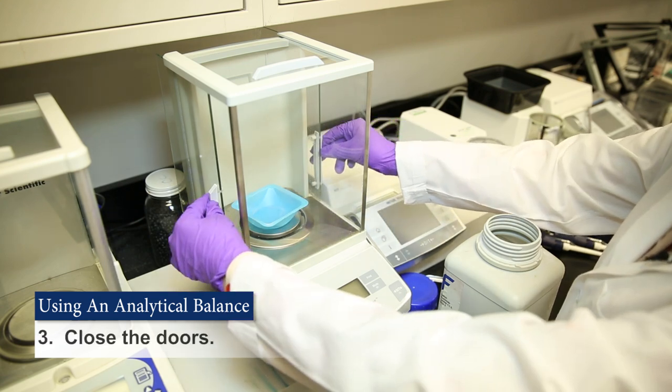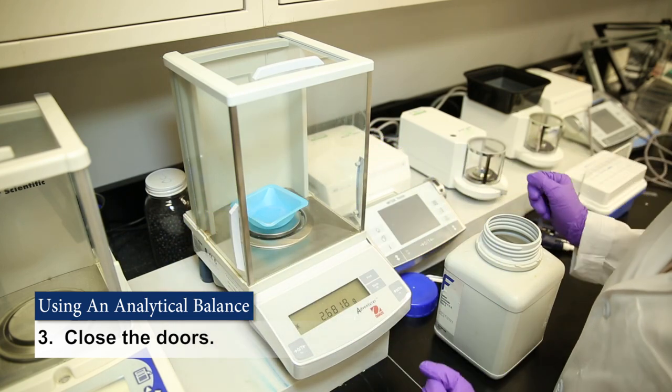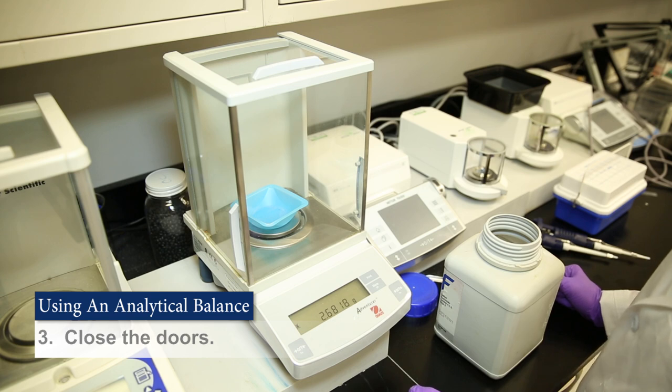You'll then want to close the glass doors. That just makes it so that no air flow is going over the material and adjusting the weight.